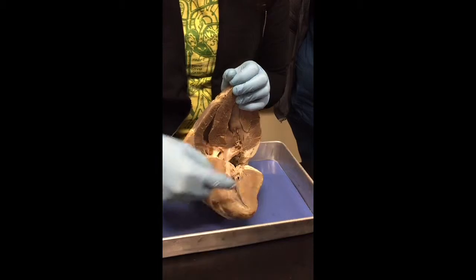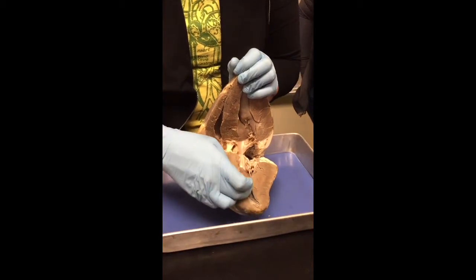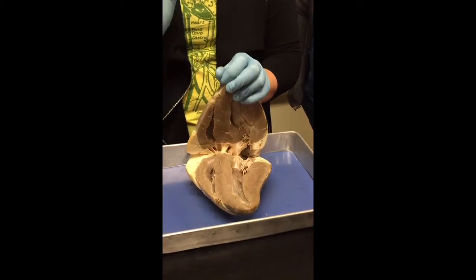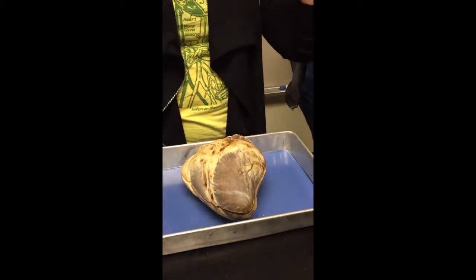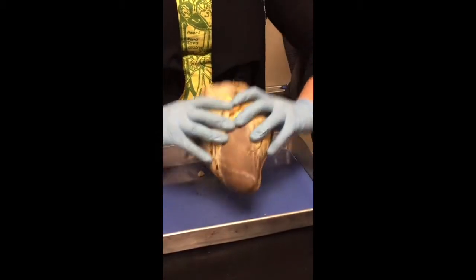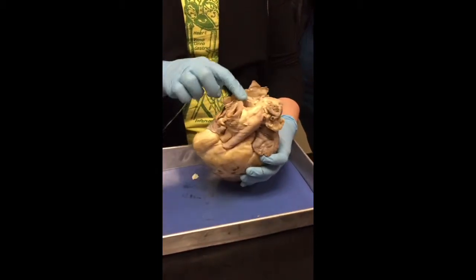So remember the contractions start towards the apex and then go up through the ventricles. So the blood is going to be pushed up and out through the aortic semilunar valve. You can't see it on the cow heart, but you can see it on the model, okay? Through the aortic semilunar valve, which does the same thing as the other valves in the heart. It's going to make sure it goes one direction only, prevents backflow. Through the aortic semilunar valve, through the aorta, this large vessel coming directly off the top of the heart, this is going to be the aorta, all right?